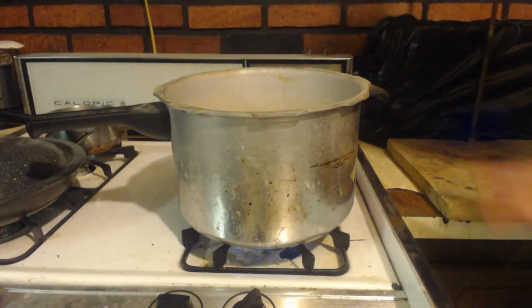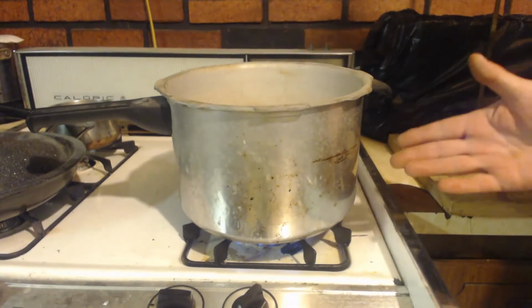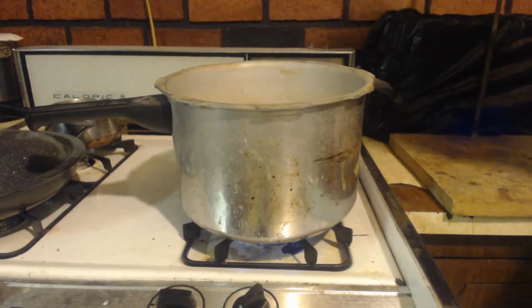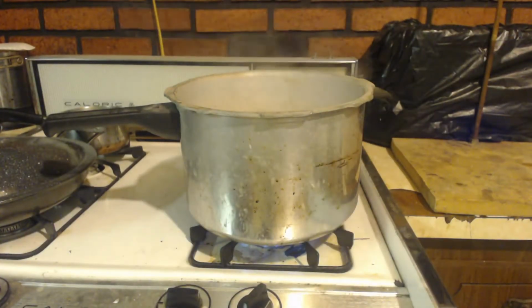Okay, so I had to move up to something bigger. I got this big pot. Put 2,000 milliliters of water in there. That's 2 liters. Plus the 500 milliliters from before. And I dumped it in there. You can see it's still got stuff that needs to dissolve. But I'll keep stirring it up and heating it. And hopefully it'll dissolve. Alright, so I brought this to a boil. Made sure everything was soluble.